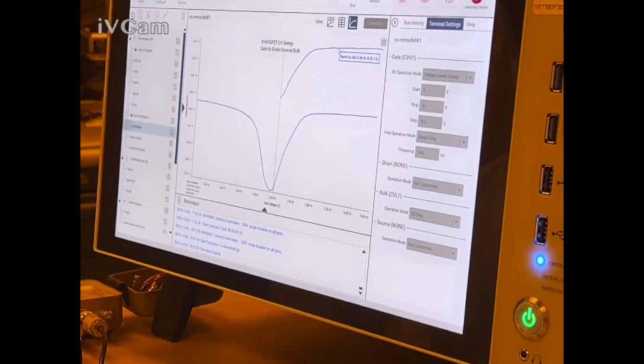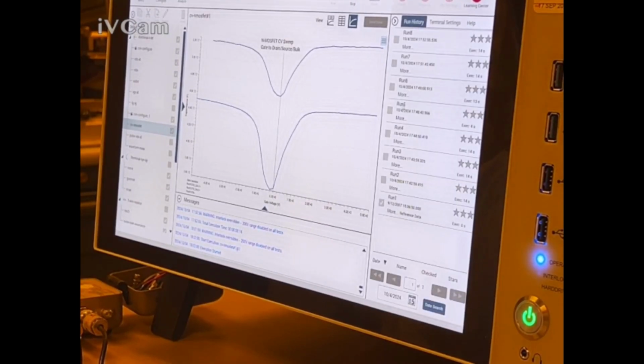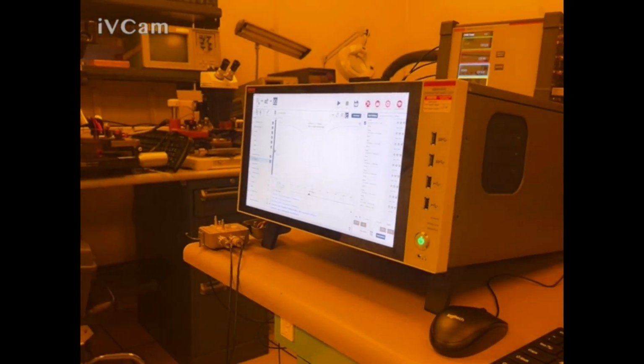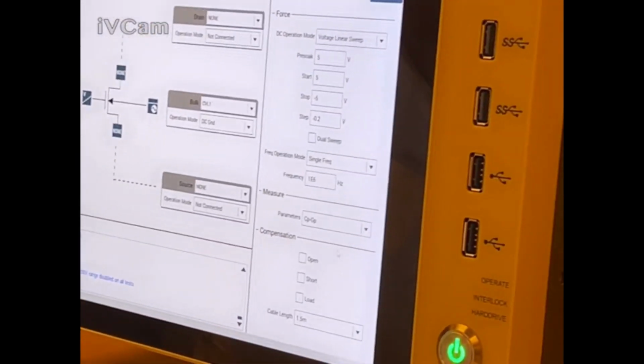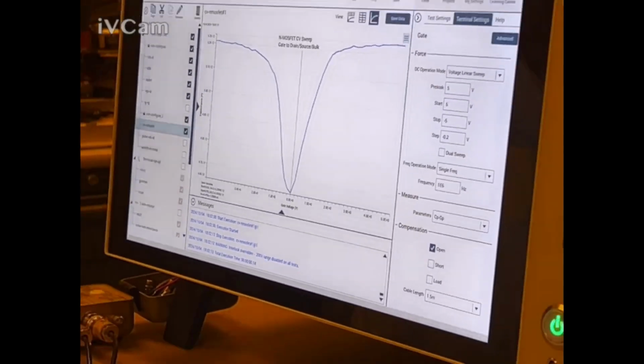Now it's working. Okay, but now let me show you something here. Yeah, this was loose, I think, is what it was. I tightened it. But, okay, so I didn't add the compensation. So this is a bogus measurement. I can show you that because it's probably going to have more capacitance than it really is. And by adding the compensation now, I can take that out. So I go over here and I'll eliminate the open compensation and watch what happens. And I'll run this again.